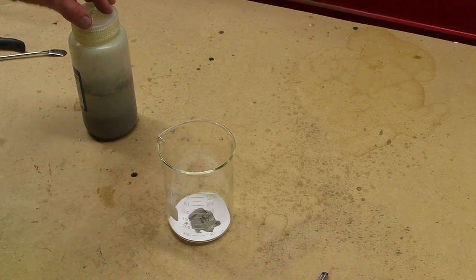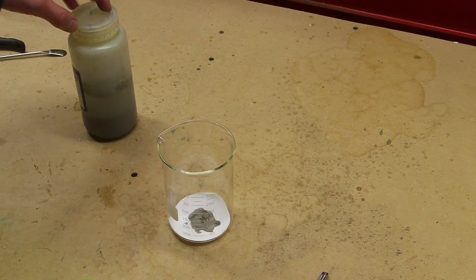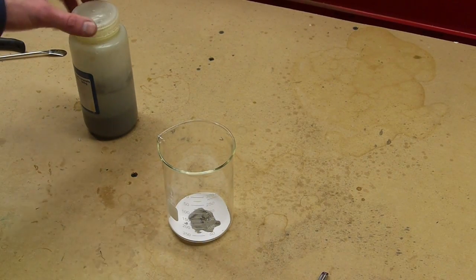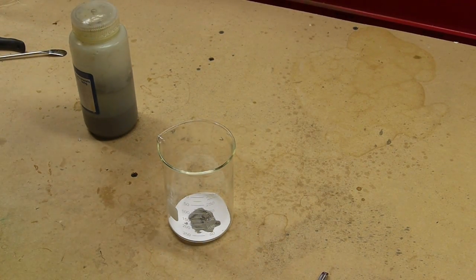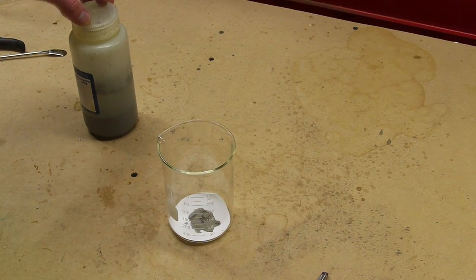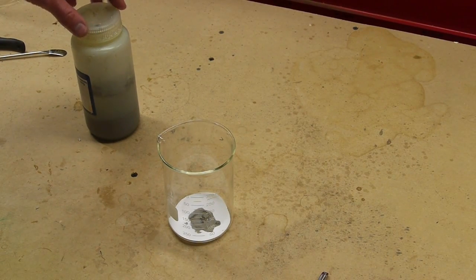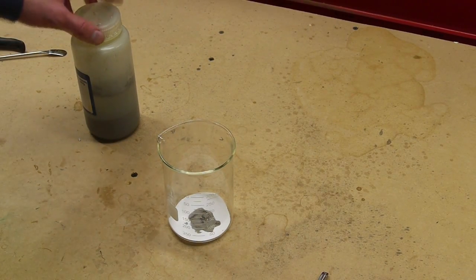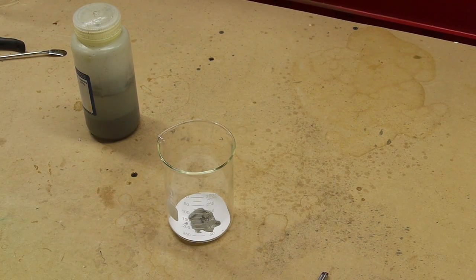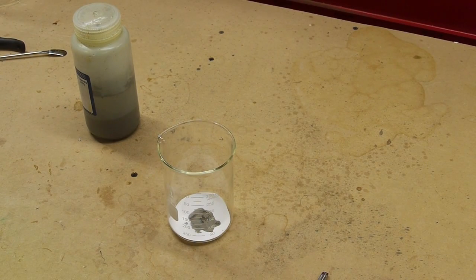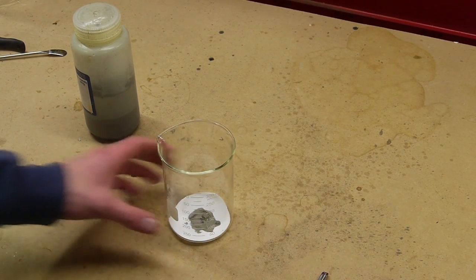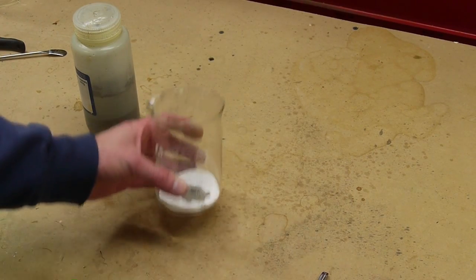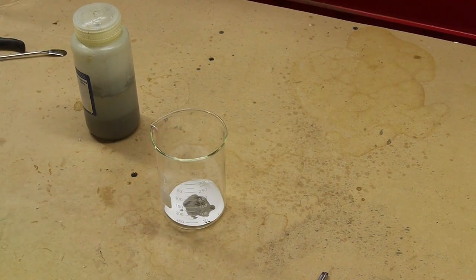I wanted to dry a small sample of this, but I was already getting kind of nervous since you're not allowed to have it partially wet. It's okay to have it completely submerged, and it's okay to have it completely dry, but how do you actually get from completely submerged to dry without having it in that sort of danger zone of just a few percent water? So I think they might be overstating the severity of this just a bit. I started with a tiny, tiny sample, and what I did is I just put it on some filter paper and left this out outdoors so that it would air dry.